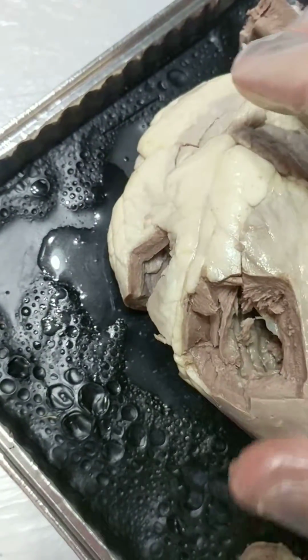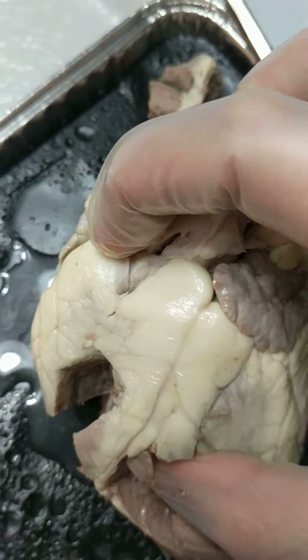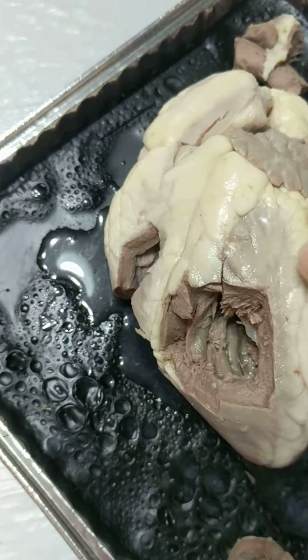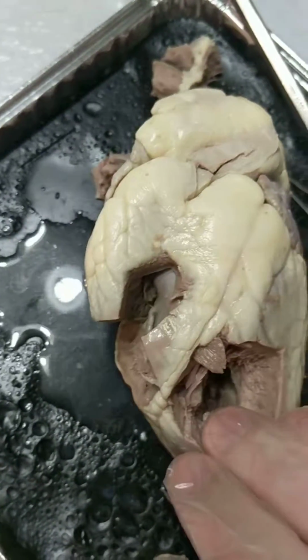The tricuspid valve is actually located right under this little flap here. That's what we pushed a probe through to see into that ventricle there. And the ventricles are, of course, the two large chambers located at the bottom of the heart.